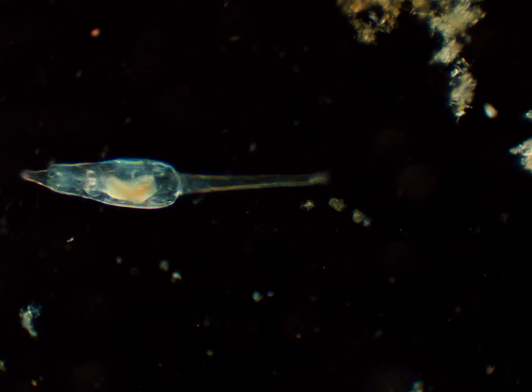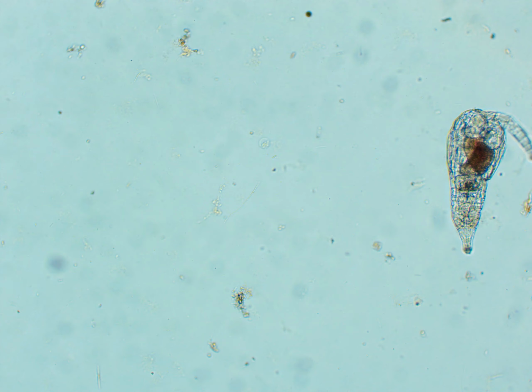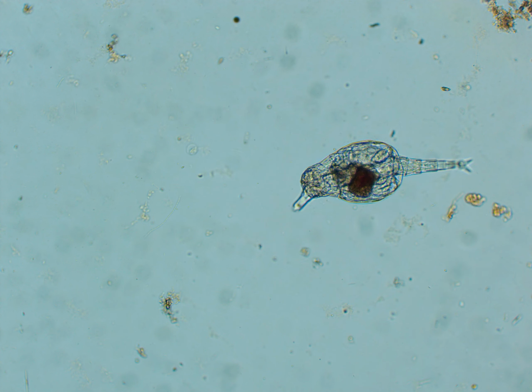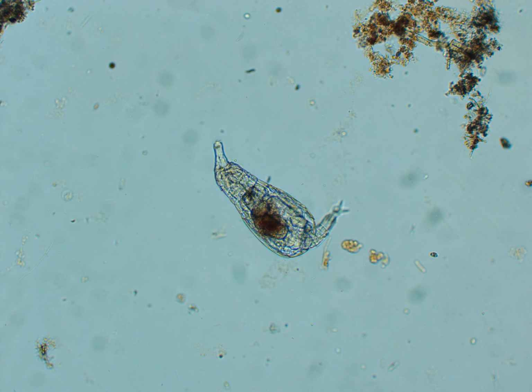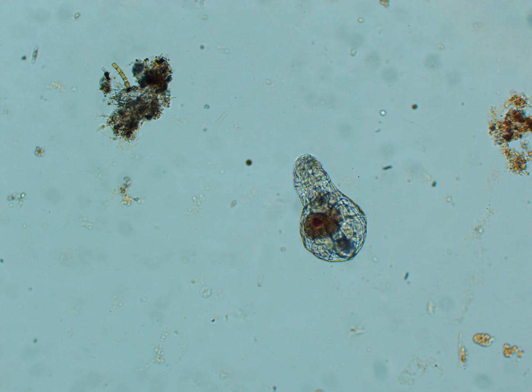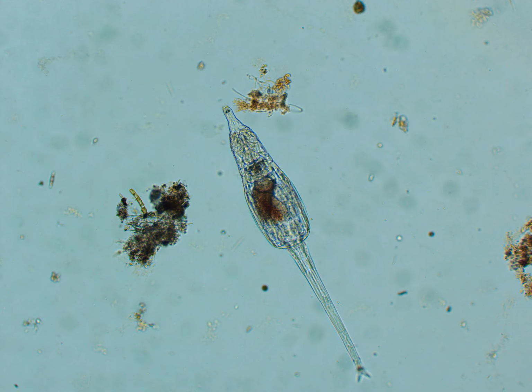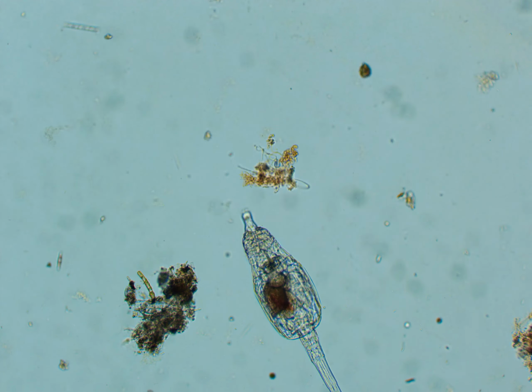They were always fun to look at, which is kind of why I'm making this video, because it's fun to get to see them again. But these are bdelloids. I found several of them on this slide, which is why I'm making a video about them, since I'm yet to make a video about the genus Bdelloidea. In this video you'll see a lot of footage, and I also was testing oblique illumination for microscopy videos, which I will talk about later in the video once I do that.